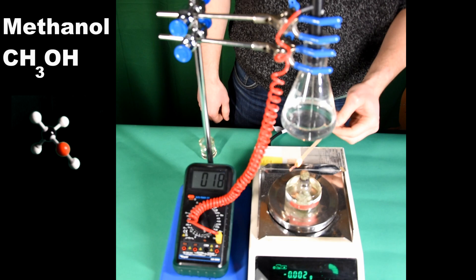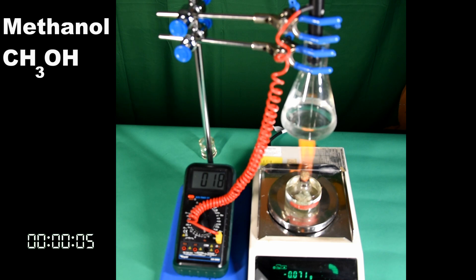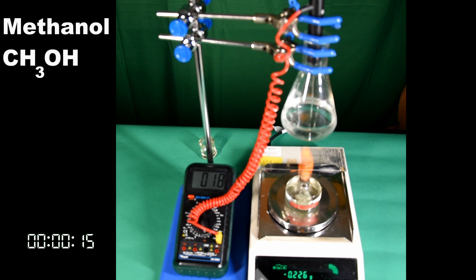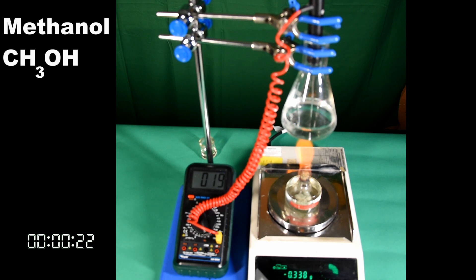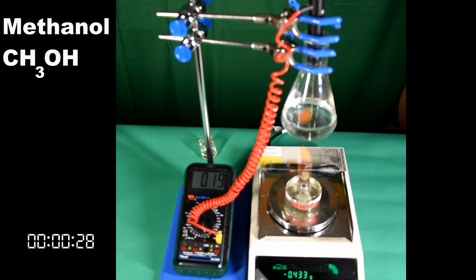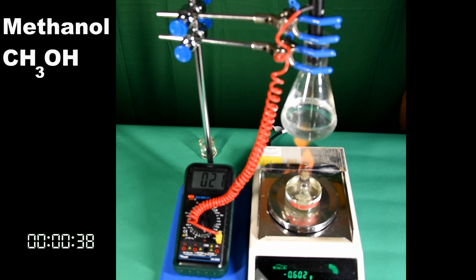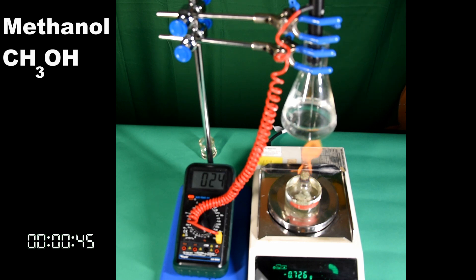The lid is removed from the alcohol and the balance is tared or zero checked. The burner is lit as quickly as possible to reduce the impact of evaporation on the results. We're going to measure the temperature change of the 50 centimetres cubed of water when 0.8 grams of the alcohol is burnt. We can then use this data to calculate the temperature change per gram of alcohol burnt.